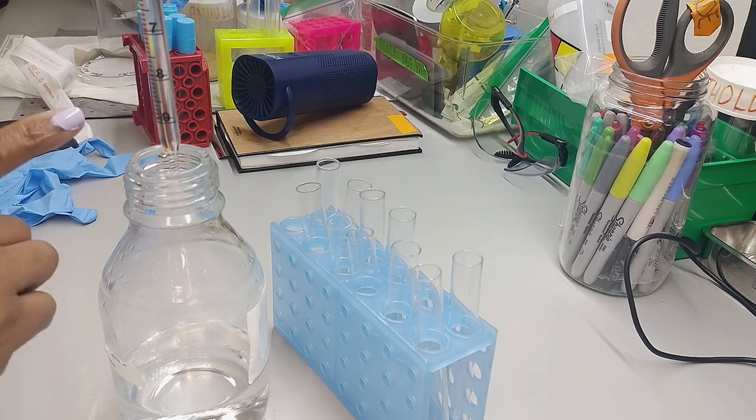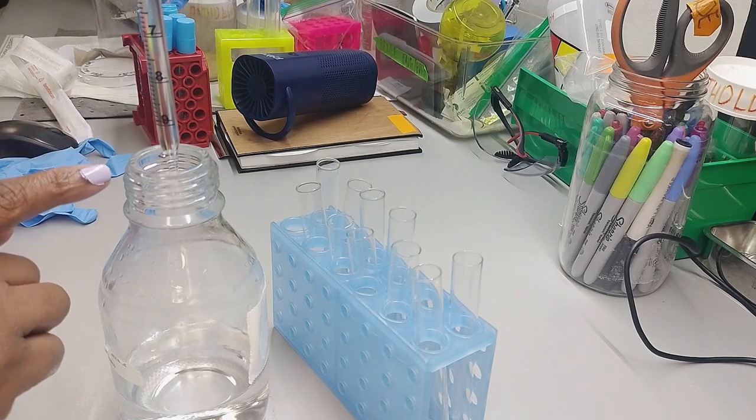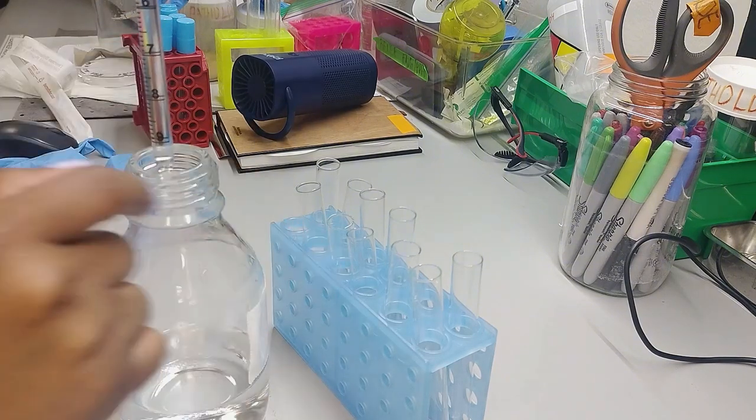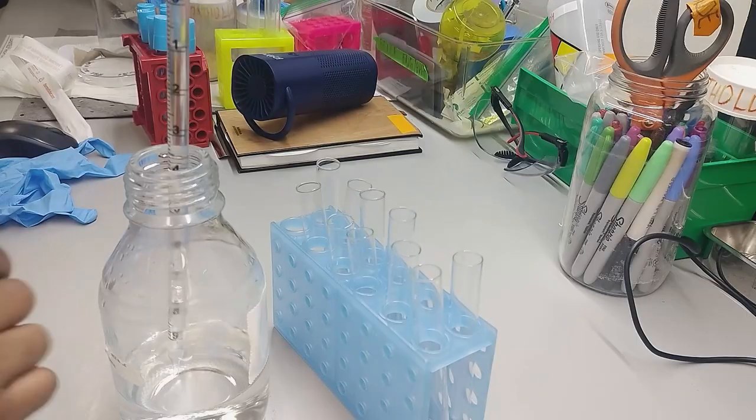So this is ten, so I want nine, so I'm just going to release this to the one and then release the entirety into each tube. There we go.